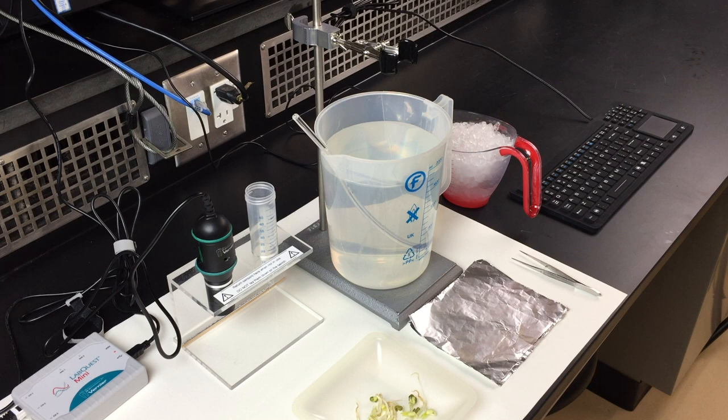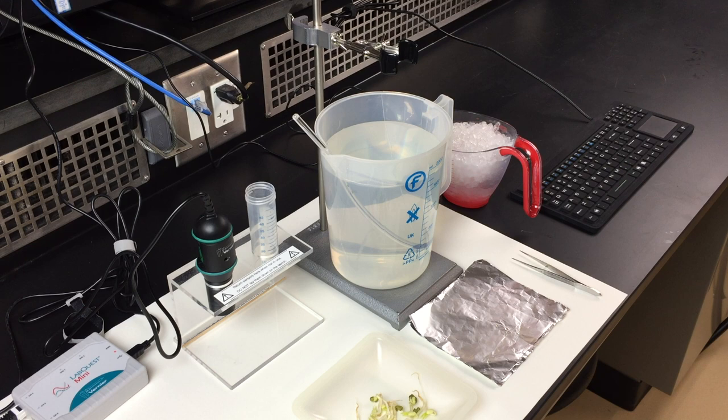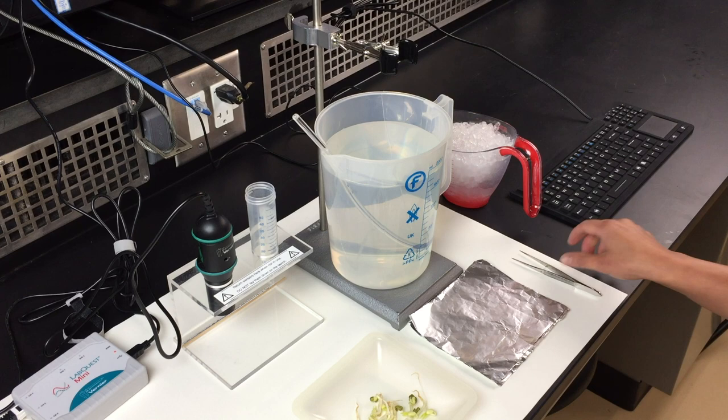These mung beans have been grown and germinated in the dark. They are not capable of photosynthesis. That's why we use them for this experiment on respiration.